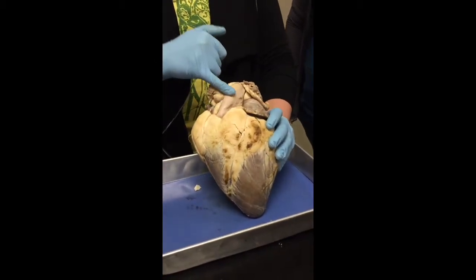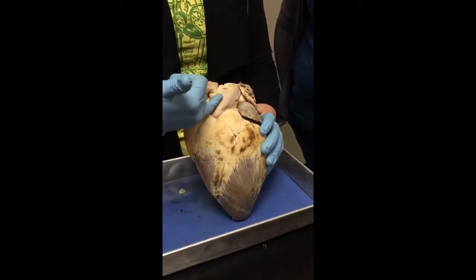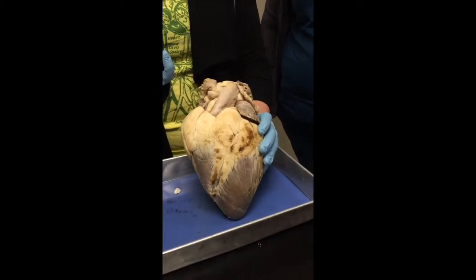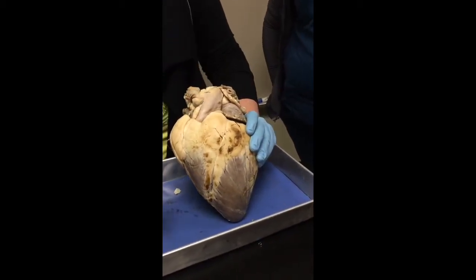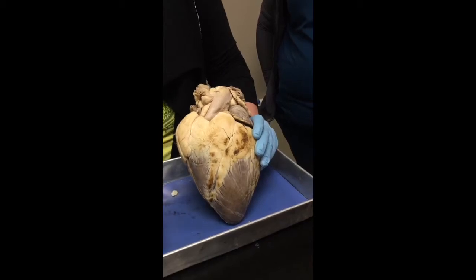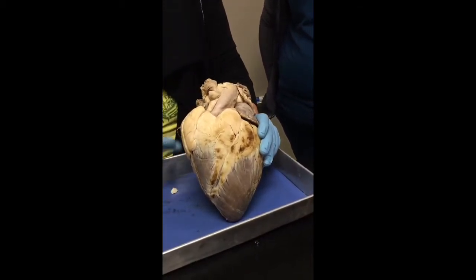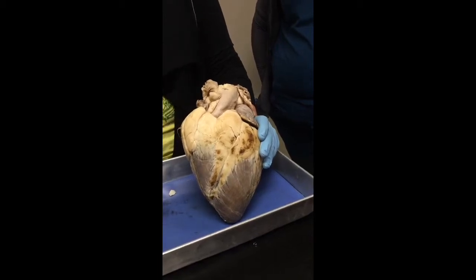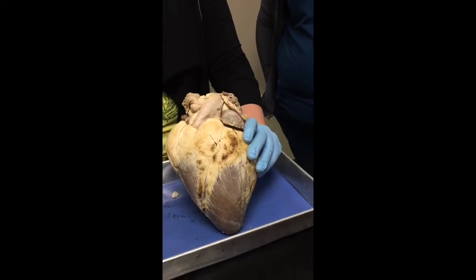This is an example of an artery that's deoxygenated, right? This pulmonary trunk, you'll also hear it referred to as the pulmonary artery, okay? It's coming from the right ventricle, which has deoxygenated blood, and it's going to the lungs, so it's leaving the heart, so it's an artery, but it has deoxygenated blood, right? Okay, so from the pulmonary trunk to the lungs.